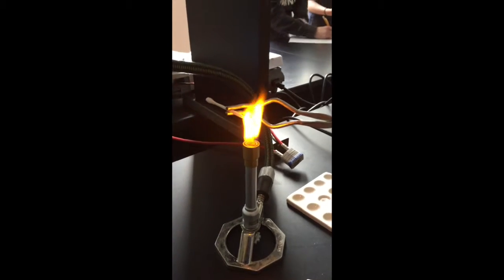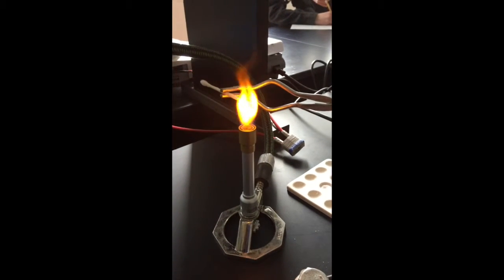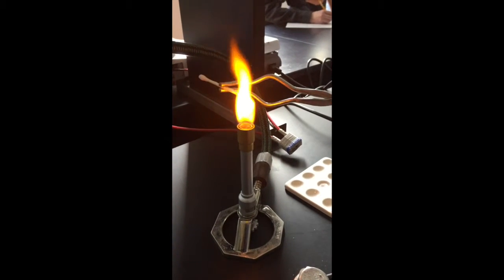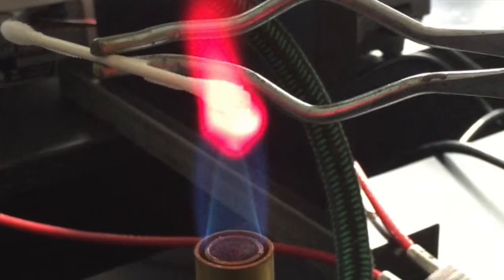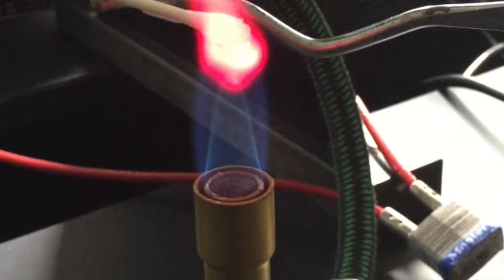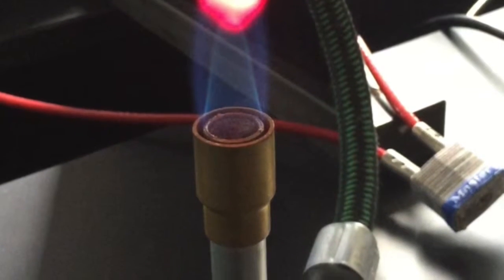The group used the colors that were observed in the different flame tests to hypothesize that element number 20 was strontium chloride or SrCl2, while element number 21 was calcium chloride or CaCl2. And to finally end the flame test, we turned the valve back to its original horizontal position and then placed all the burnt Q-tips back in the beaker.